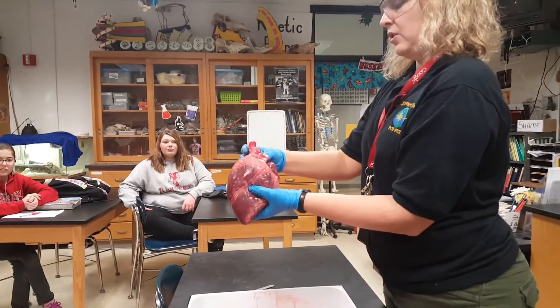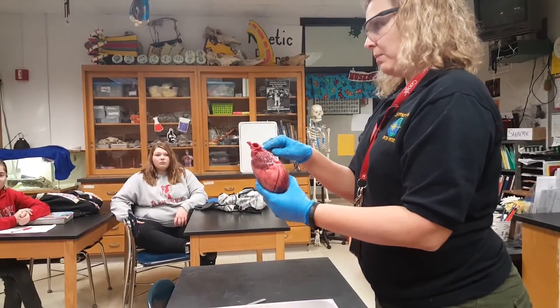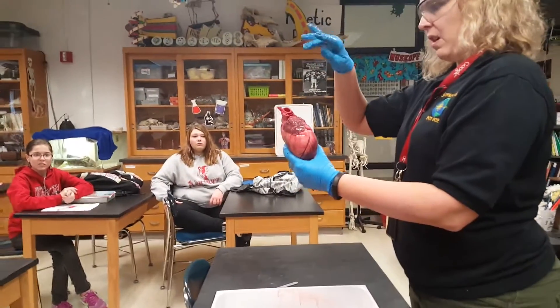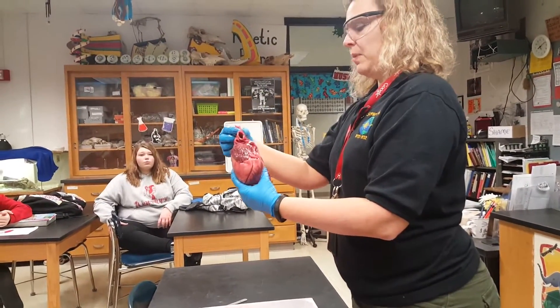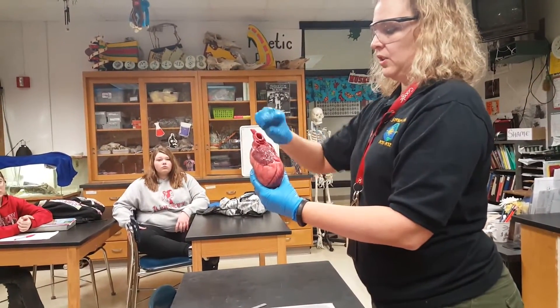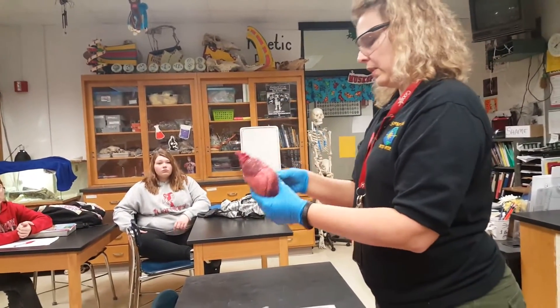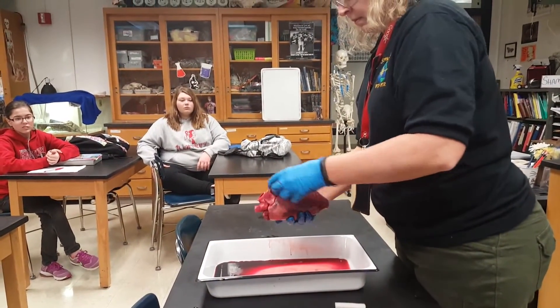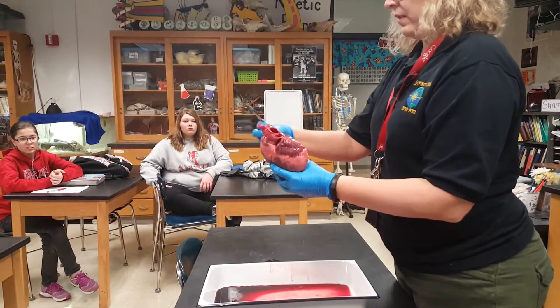And then the little branch tops there. I haven't really studied deer hearts, but on the sheep heart you guys dissected yesterday, we have the three arteries on top: brachiocephalic, common carotid, and subclavian. On the deer, I'm going to assume it's just got the one, and then it branches into the carotids and the subclavians. So now we've got the auricle, which is the flap over here — the ear of the heart.